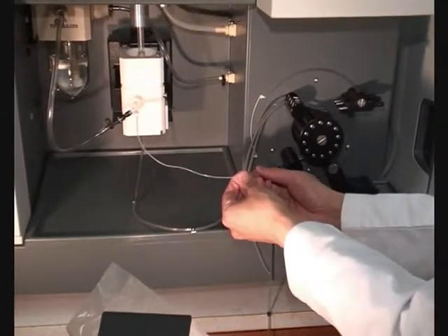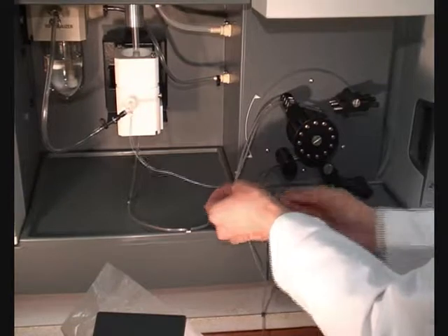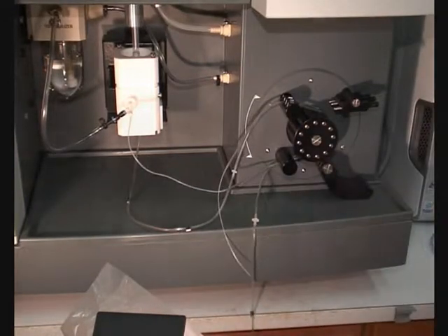Attach the lower end of the sample tubing to the nebuliser. Place the upper end of the sample pump tubing in the sample solution.